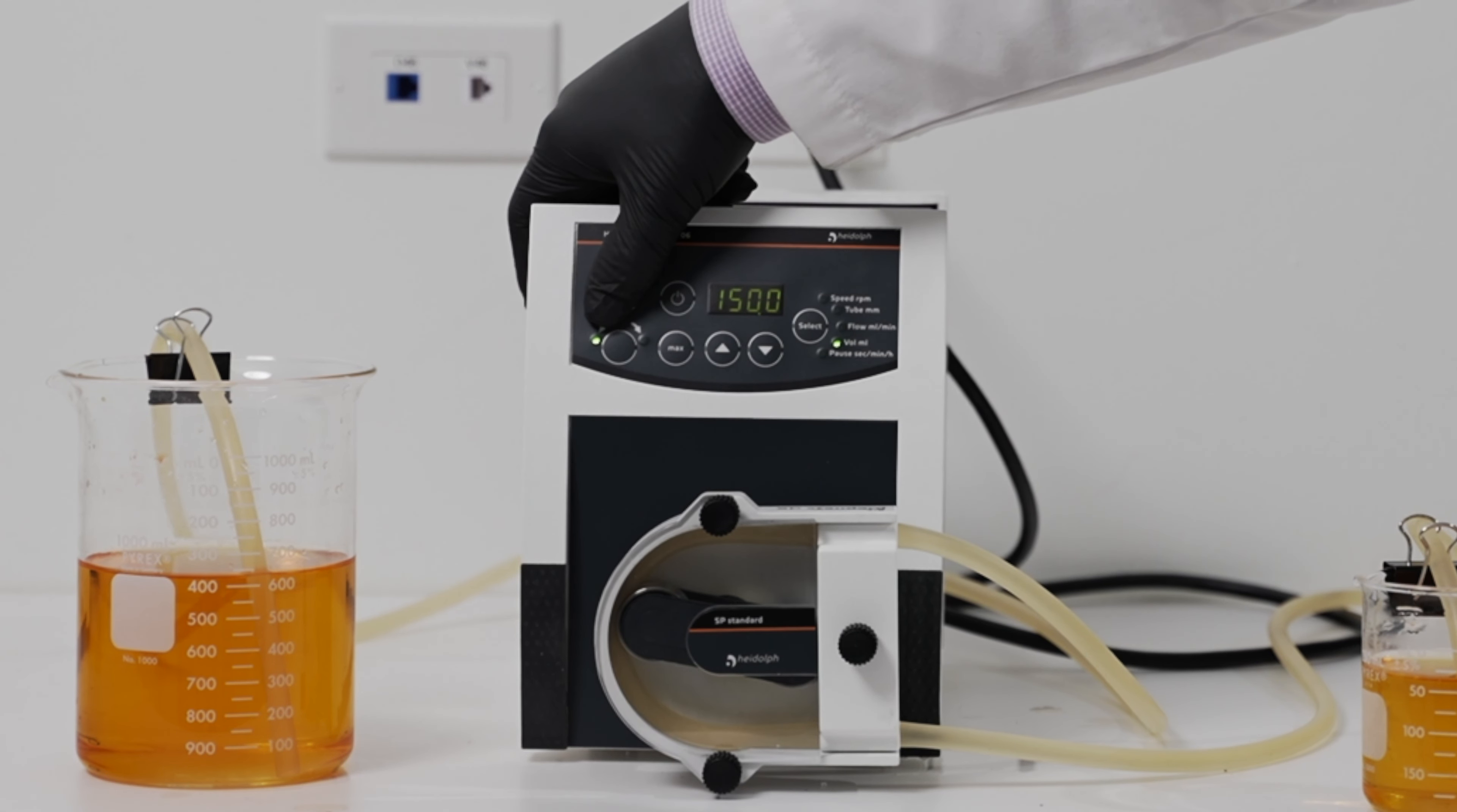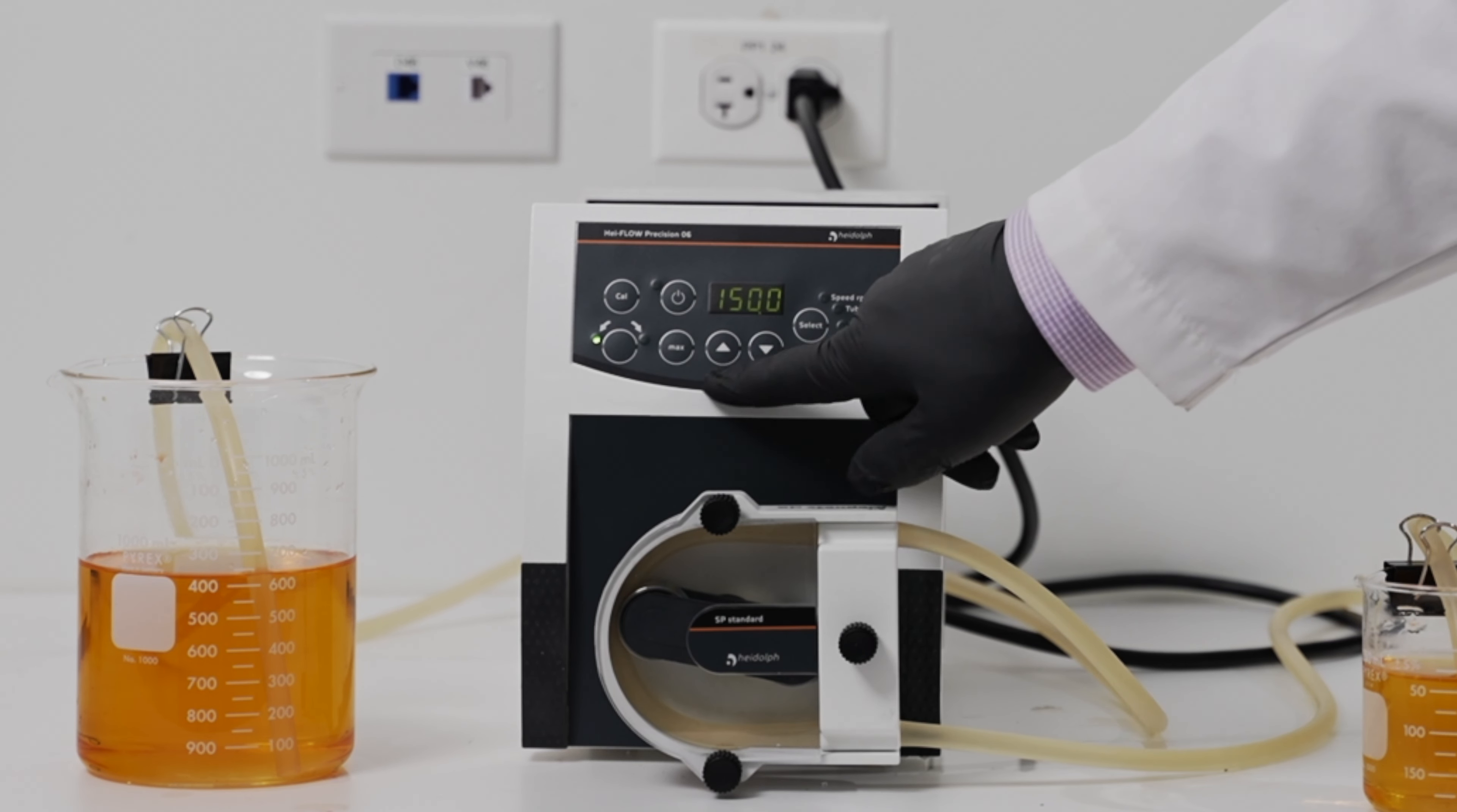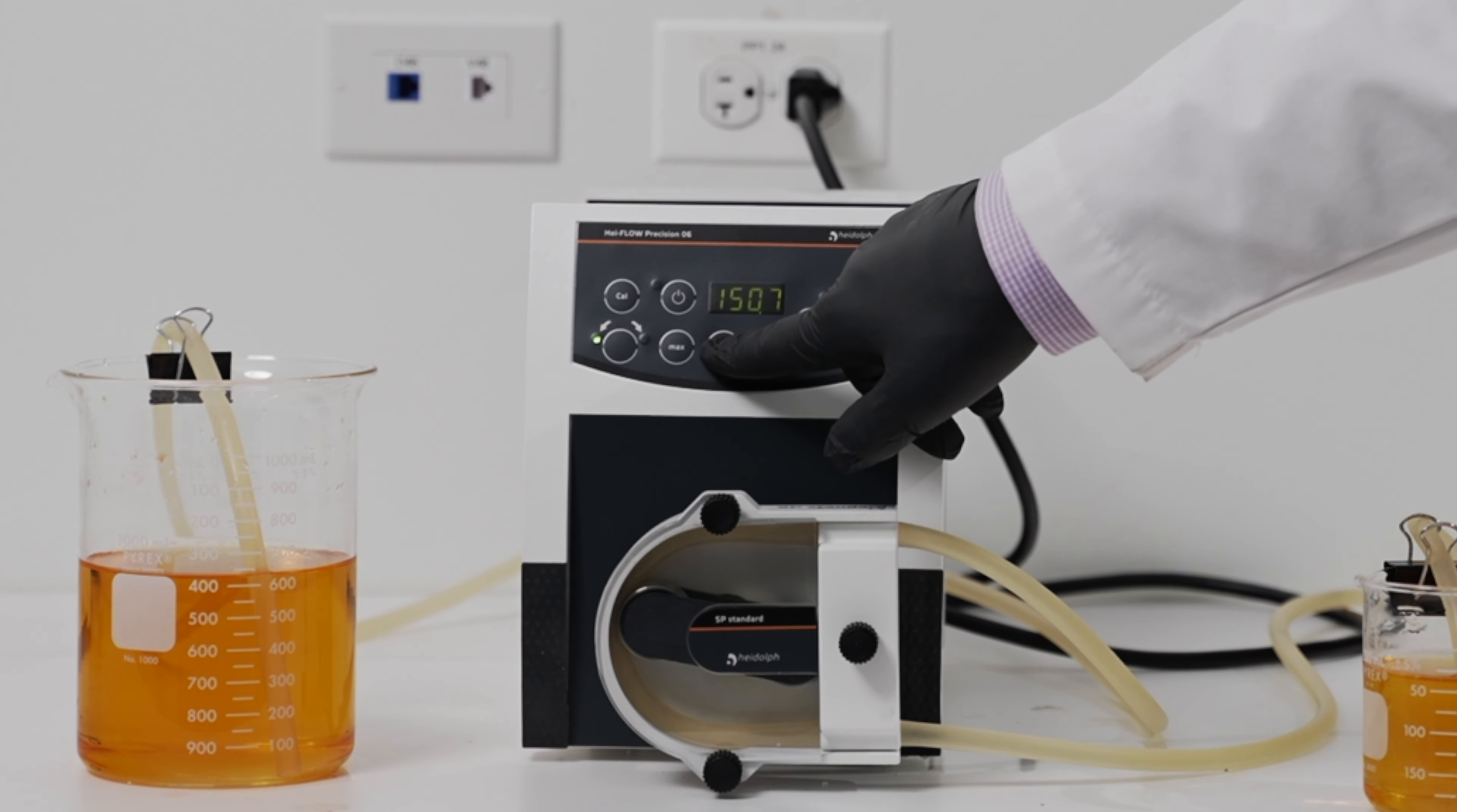We'll push the calibrate button, where we'll see the screen blinking. And we will raise that volume to what we observed, which was about 170.